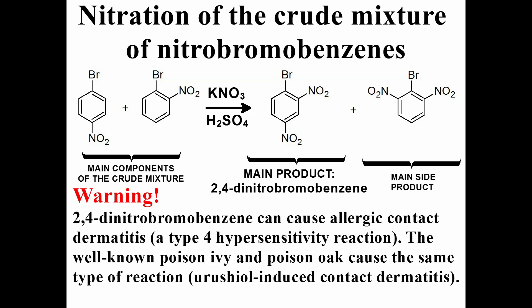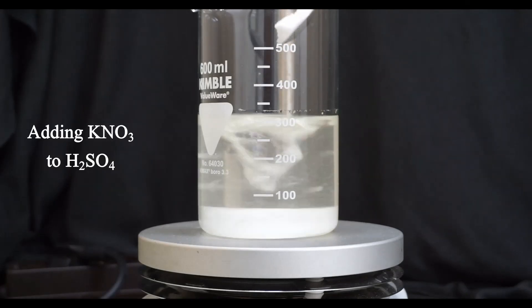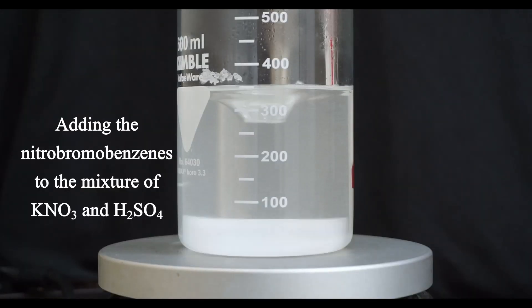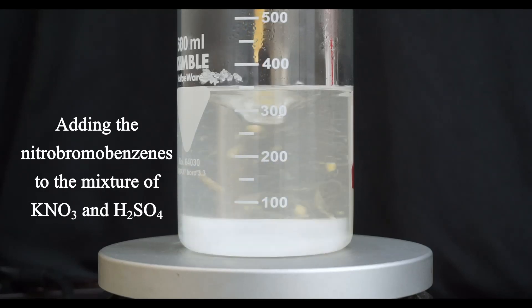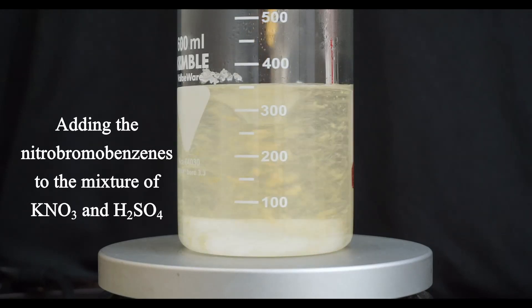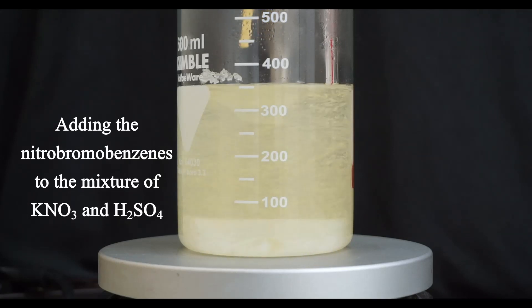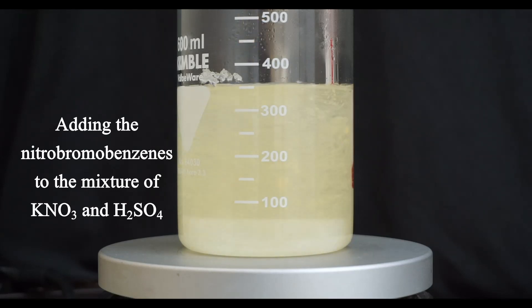I put notes on my other modifications of that procedure in the video description. I'm sorry, but I didn't really take much video of the procedure as I was starting from an undefined mixture, and as such the procedure would be of limited value to someone that would want to repeat it. After crystallization, filtration, and drying, I got 73.3 grams of dry 2,4-dinitrobromobenzene. This represents a 31% yield based on the 100 ml of bromobenzene.